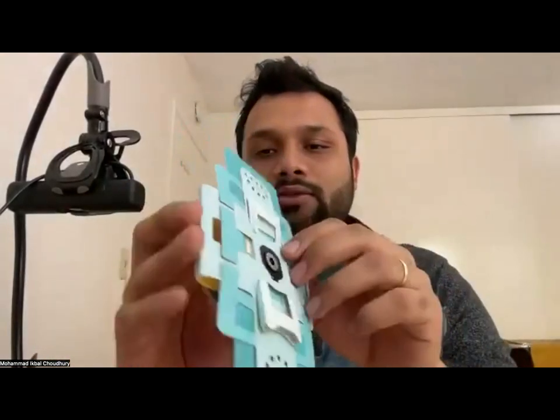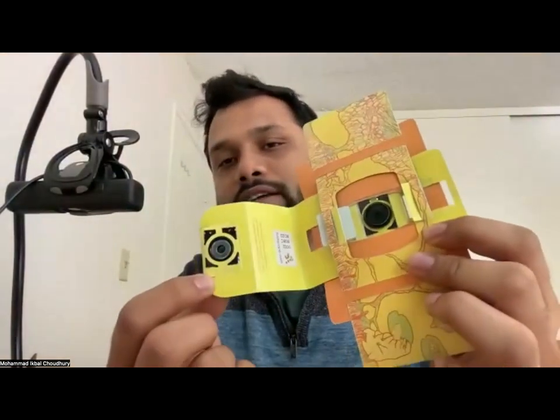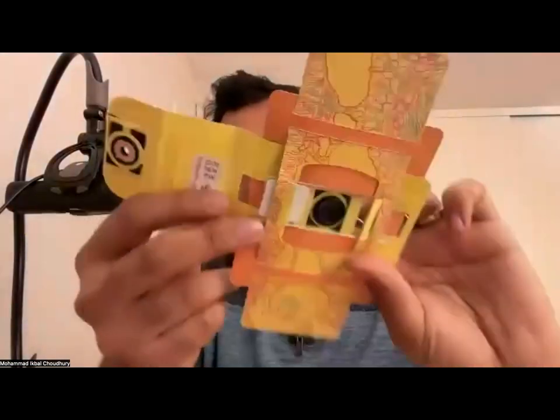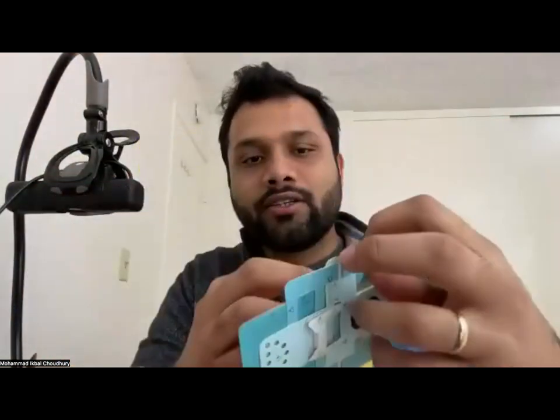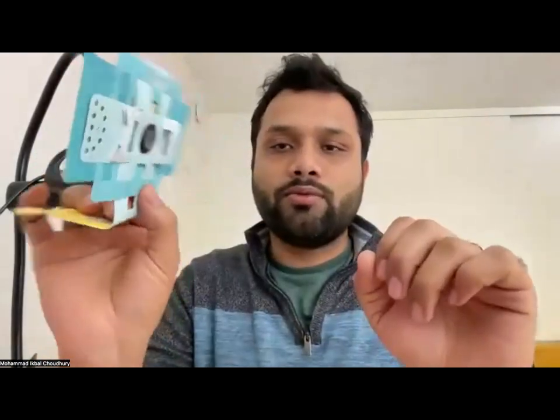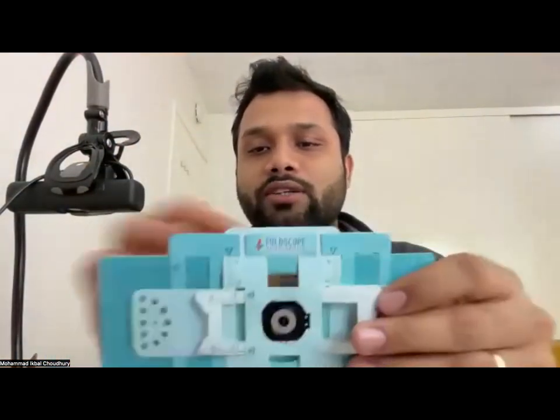So as you can see, if you flip it, you can open up this piece here, right? There you can see there's a black plastic thing here, and there is another plastic thing with a lens there. So what I have done is I've taken this slide that you all must have received and I've put it inside the foldscope, but I'll do it again just to give you a demo. However, let's just explore the foldscope for what it is right now. So you have the foldscope, as you can see. Feel free to move it around and try to see what you can do with it.